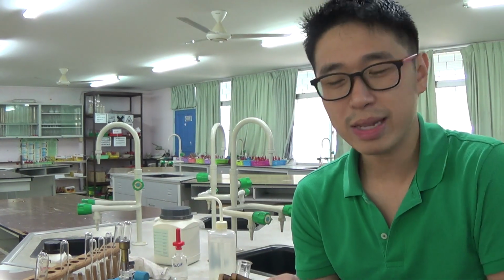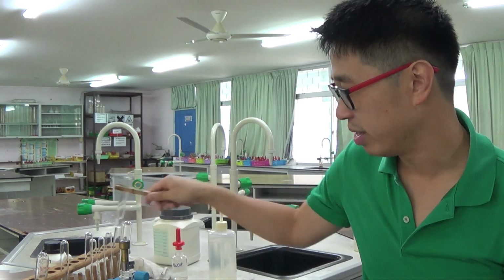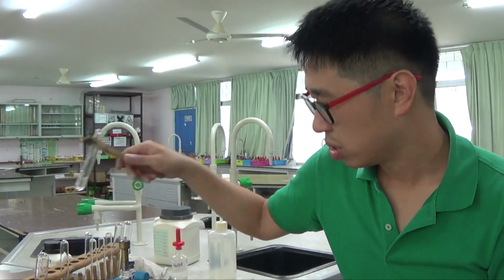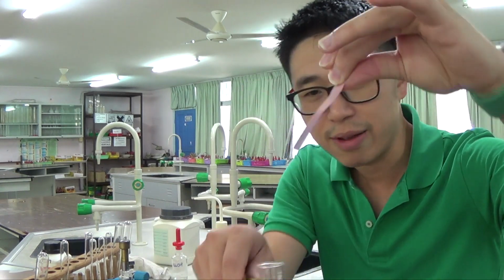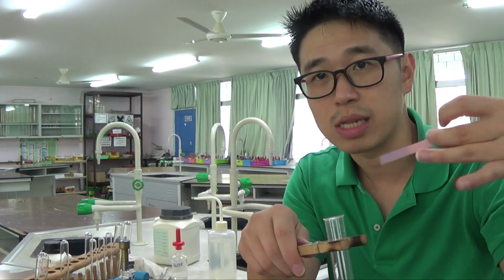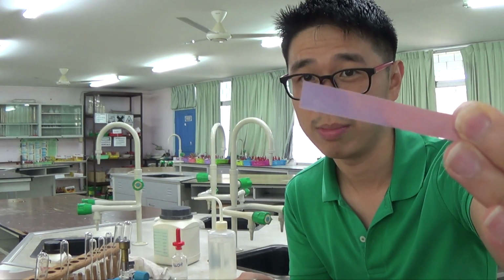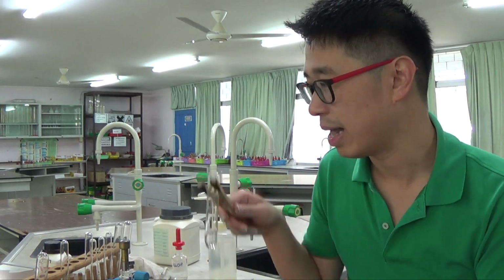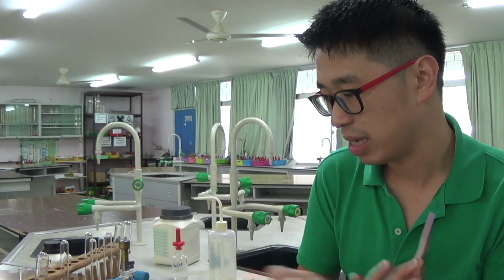That's why your urine smells like ammonia when you go to the toilet, and that's why this thing smells a bit like the toilet, you know, when you pee. Okay, so there's a gas being given out. The gas is pungent. We are testing for the gas, not touching the side, because we do not want to test for sodium hydroxide, which obviously will turn red litmus paper blue because it's an alkaline solution, but we want to test for the alkaline gas. So really speaking, we were testing for the gas.